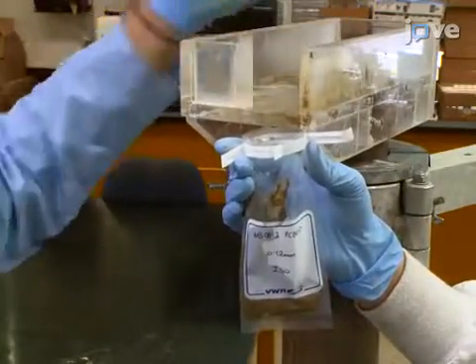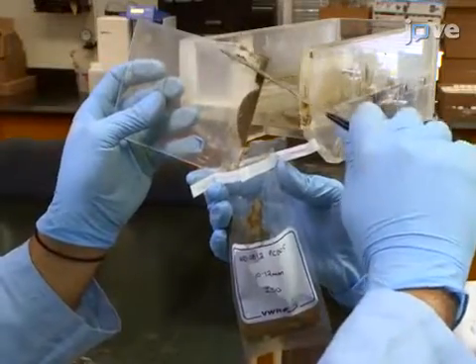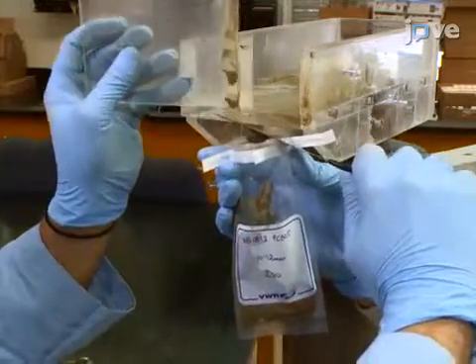Next, clean up the remaining sediment around the collar, plate, and any other surfaces and transfer it to the collection vessel.